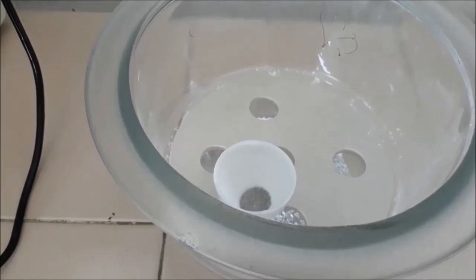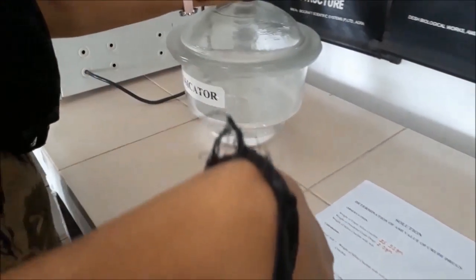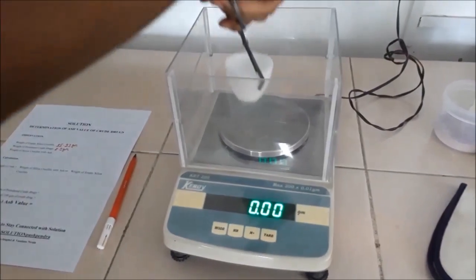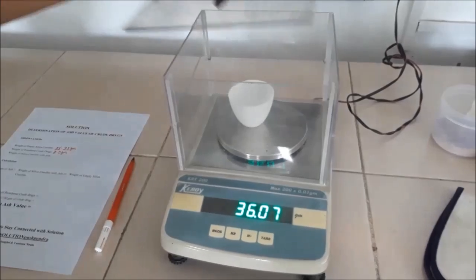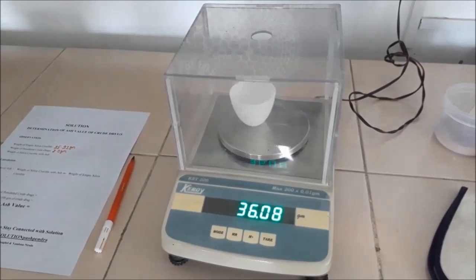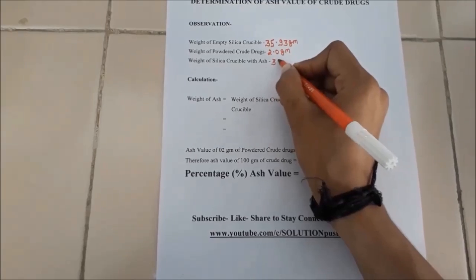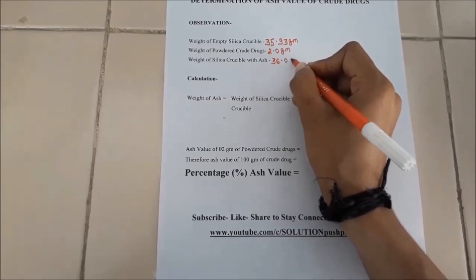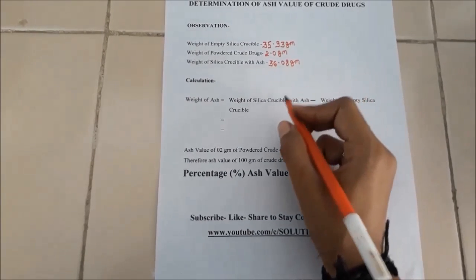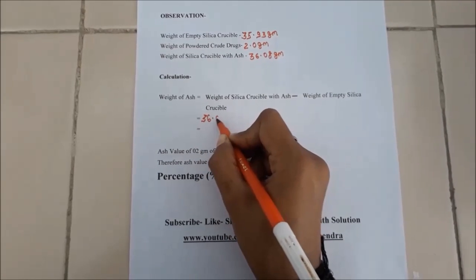Here you can see that the ash has become totally white, which indicates the absence of carbon. Then cool it in the desiccator for about 30 minutes and then weigh without delay. Here the weight of the ash with the silica crucible is 36.08 grams. Record this weight as the weight of silica crucible with ash.